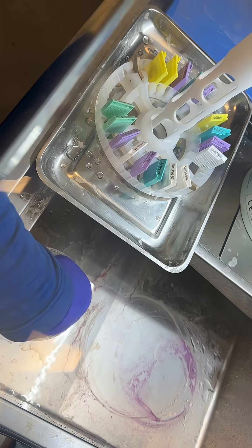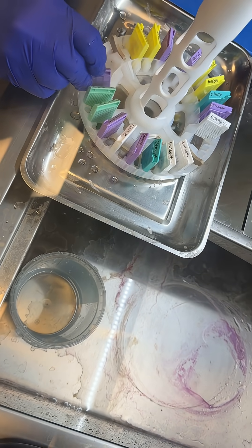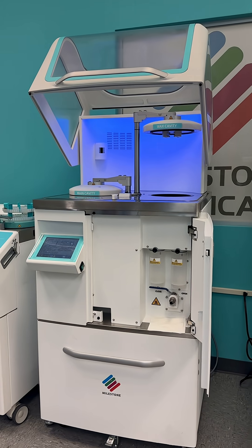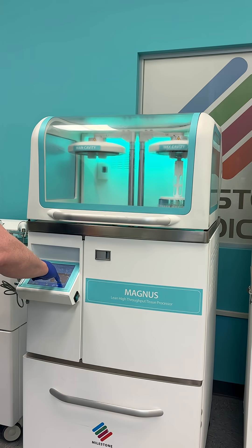This entire process happens inside a tissue processor — a specialized instrument that automates each step with precise temperature control, timing, and reagent flow.